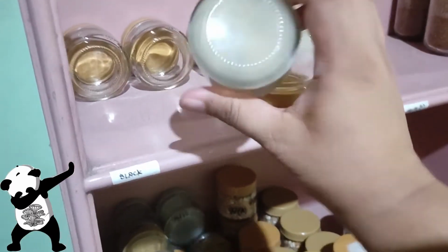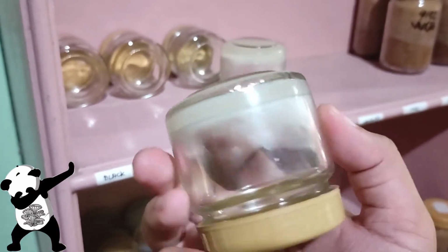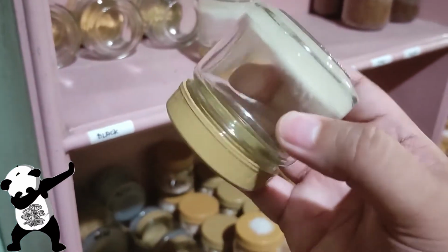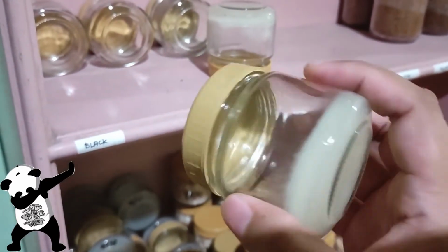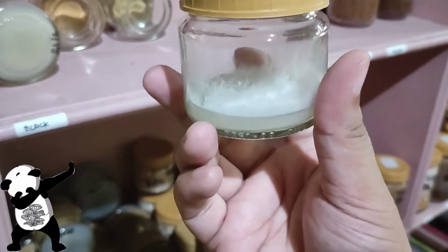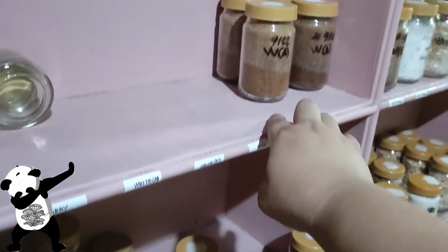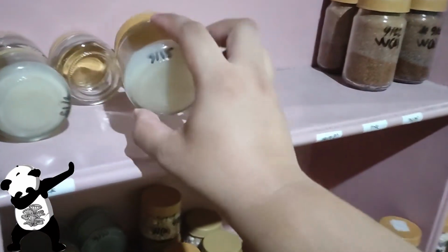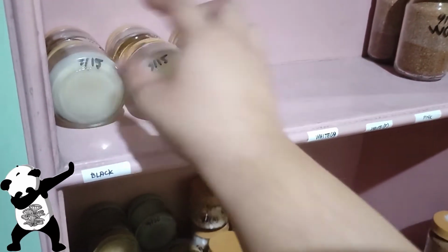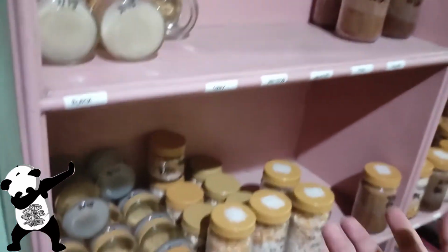And these are the plates inoculated on September 15, which actually grows some mycelium, which I don't know what strain it is. Probably this is mycelium. And this is one of the things that I told you about a while ago. I didn't open this after sterilization. It just grows something inside it. So that's probably molds. So I do have a crazy idea of using them to inoculate some sawdust jars and see what kind of mushroom or molds this is, because I don't know. It's gonna be a cool experiment, but it's gonna be on a different video.